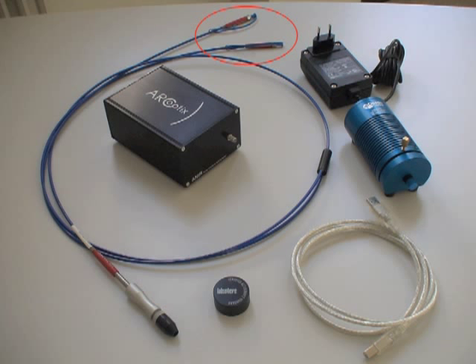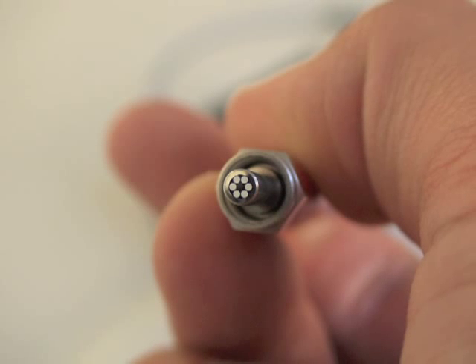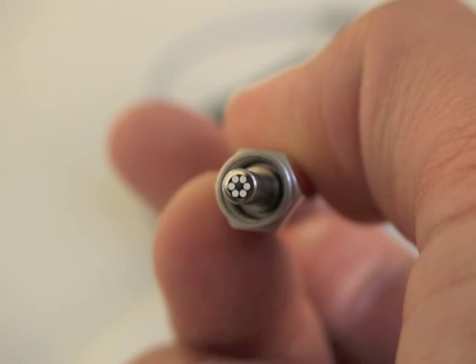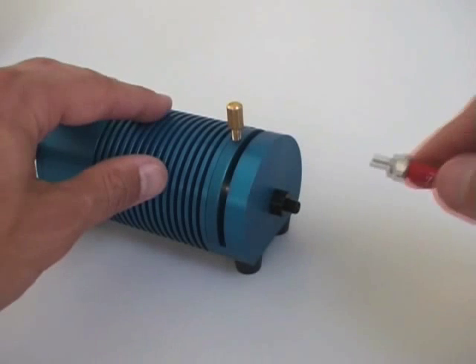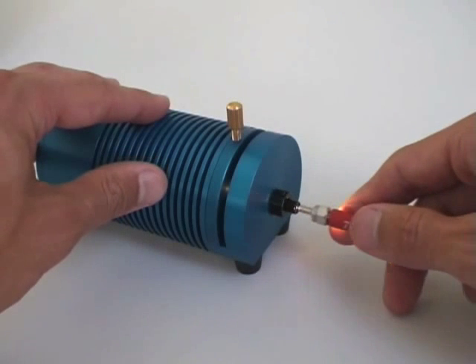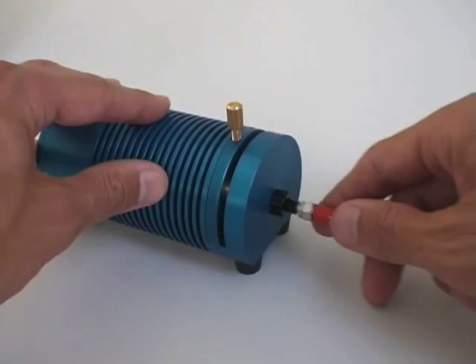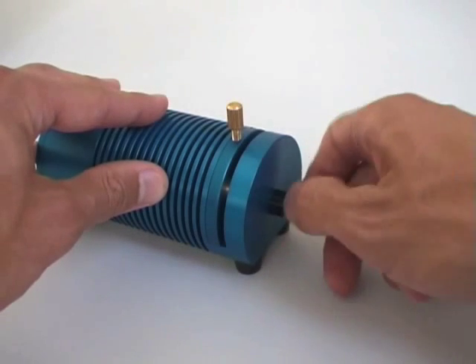Now take the fiber reflection probe and have a look at the bifurcated fiber ends. One of them has six fibers arranged in a bundle. Put this end into the light source and tighten it well with your fingers.